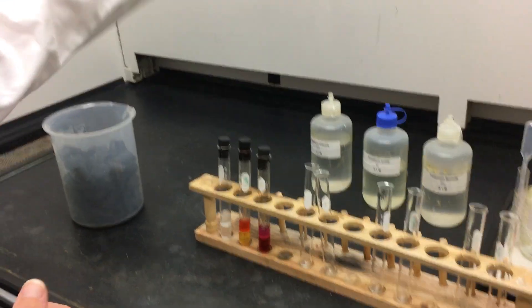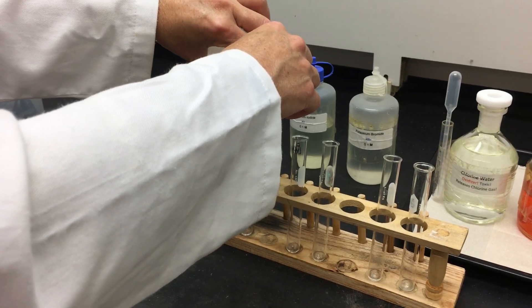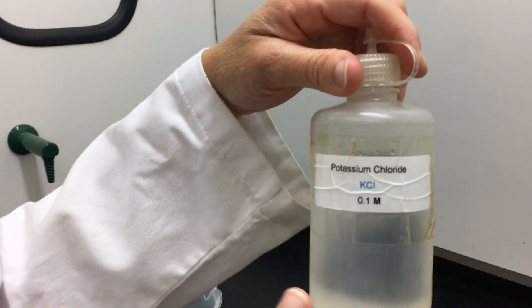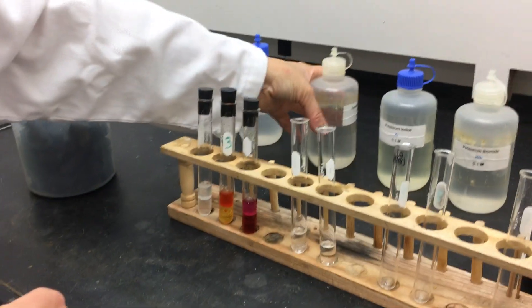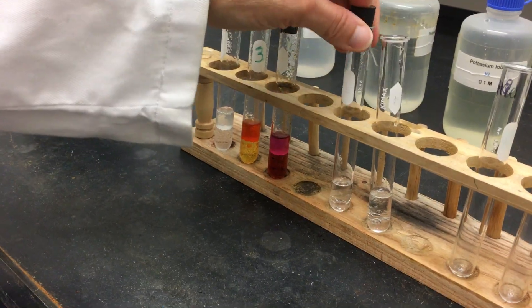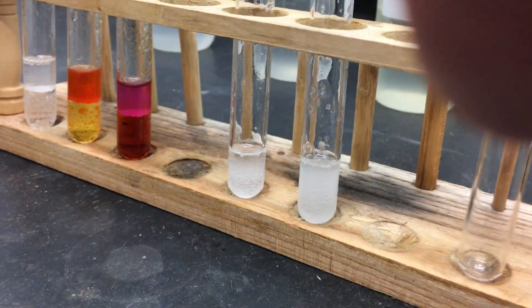Following the procedure, we add one milliliter of mineral oil to two test tubes. Then we add a solution of potassium chloride — KCl — about one milliliter to the first, and potassium iodide, about one milliliter, to the next. We shake both test tubes. Notice they both have two layers but are both clear — because we haven't added the halogens yet. It's the halogens in their elemental form that have the characteristic color.